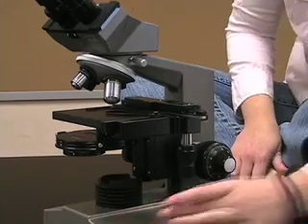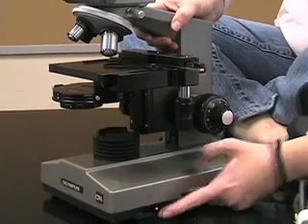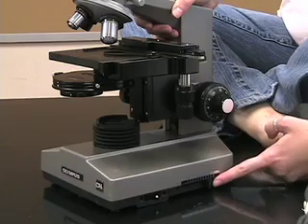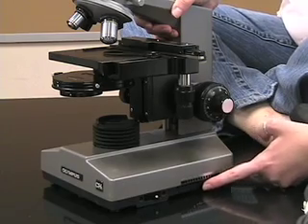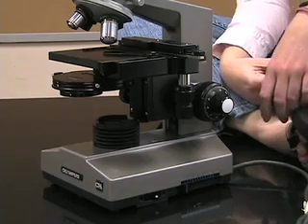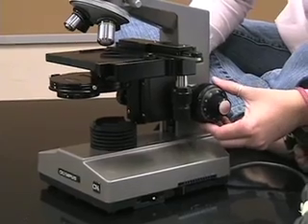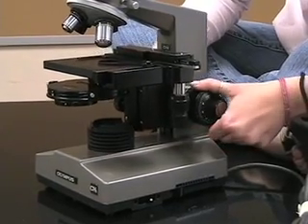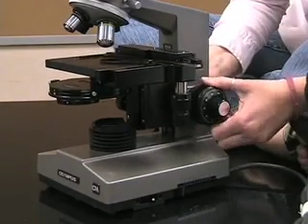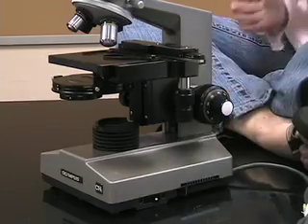Down here you have the light source. You turn it on using the on/off switch located at the very bottom. There is also a sliding piece that adjusts the amount of light coming through the light source onto your sample. Towards the back of the microscope you have two focusing knobs: the coarse focus, which is the big knob, and the fine focus, which is the smaller knob.